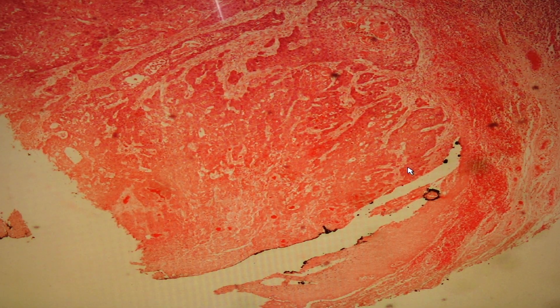Next we have slide 27, squamous cell carcinoma. Squamous cell carcinoma has the same features whether found in the lung, oral cavity, or skin, and accounts for 95% of all head and neck cancers. It is associated with tobacco smoking, alcohol drinking, betel nut chewing, and paan chewing. 70% of squamous cell carcinoma of the oropharynx is associated with HPV16.